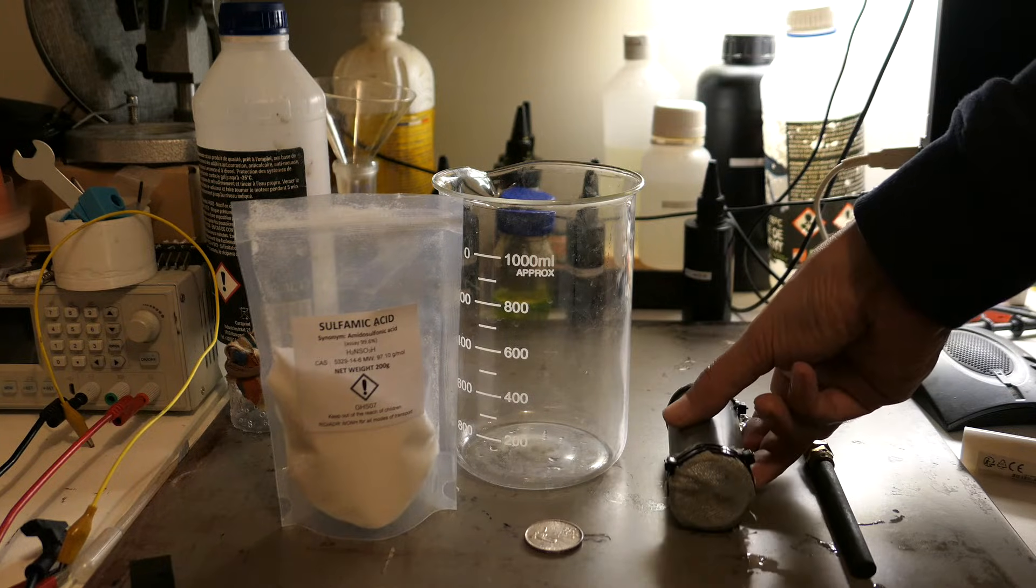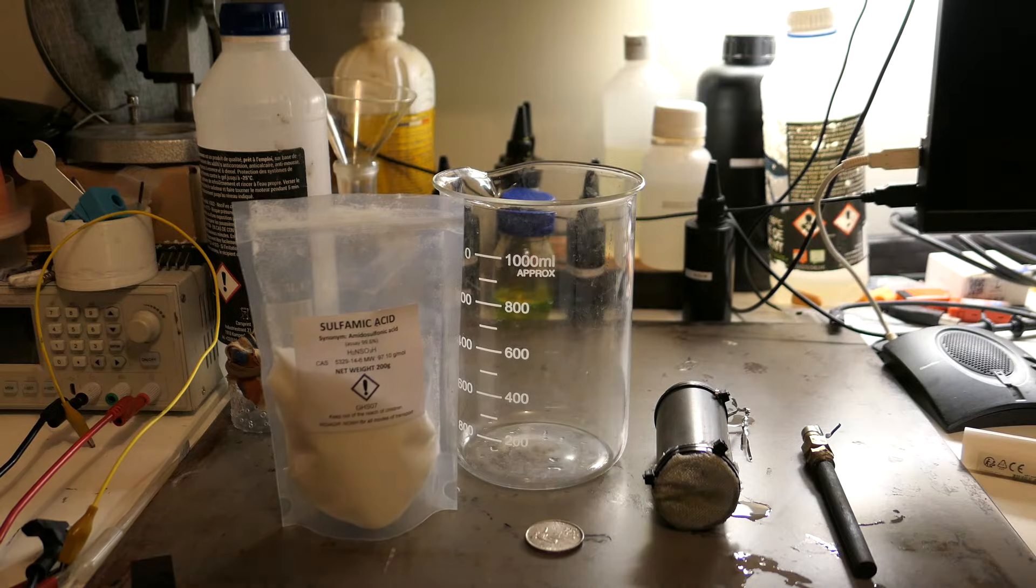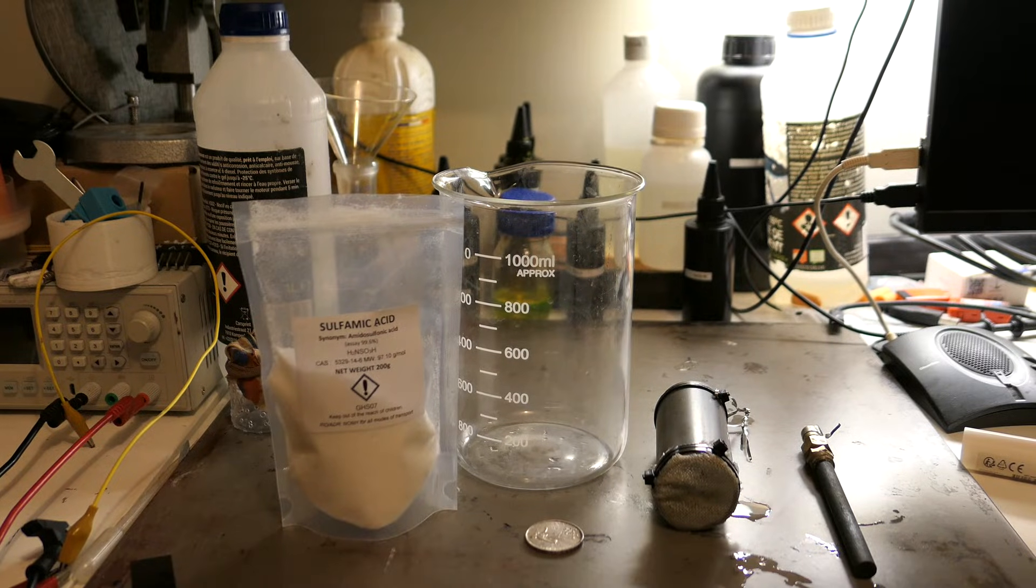While I'm preparing the electrolyte, which is simply water and sulfamic acid, I'll explain the process in more detail.